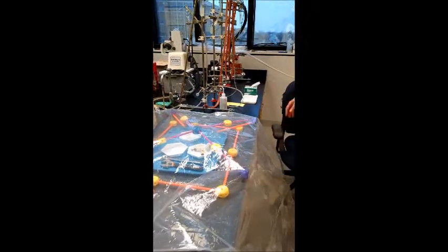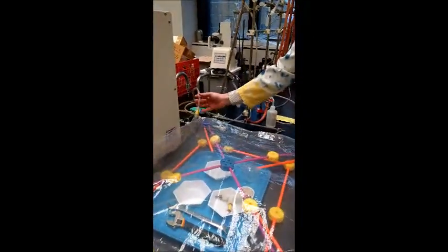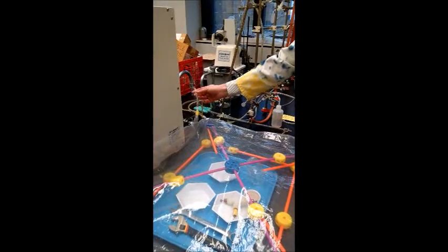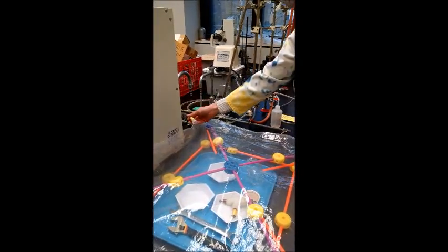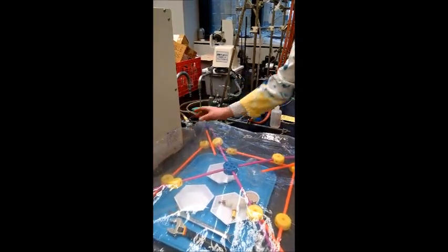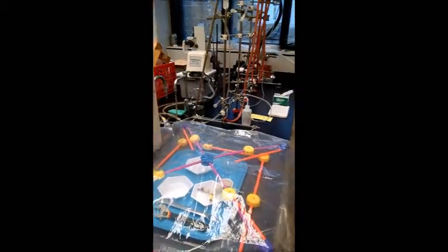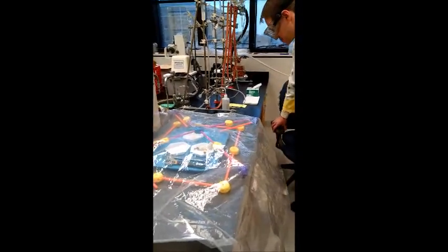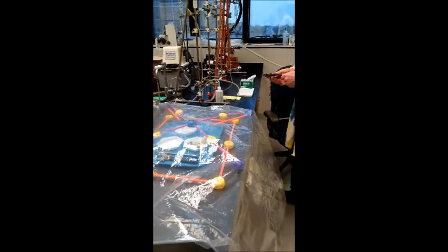We've hooked up the glove bag to tubing to an argon tank and the argon is flowing into the bag. What we're going to do is fill the bag three times to purge it of the air.